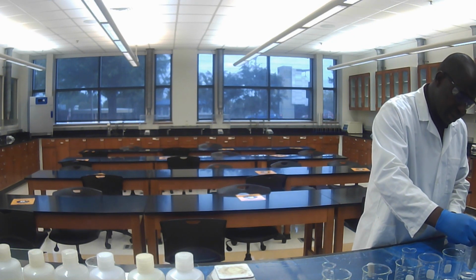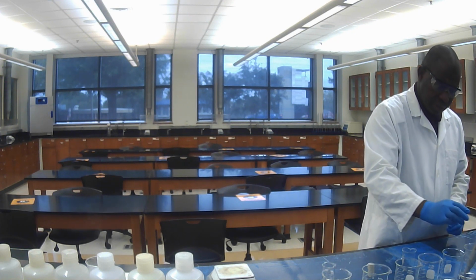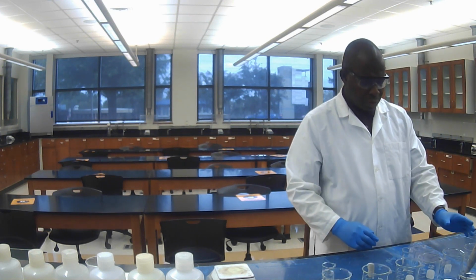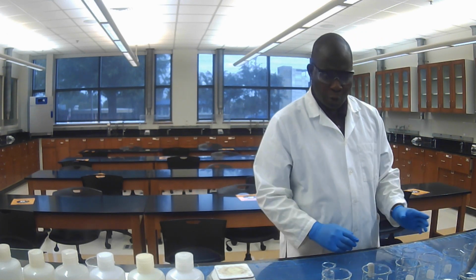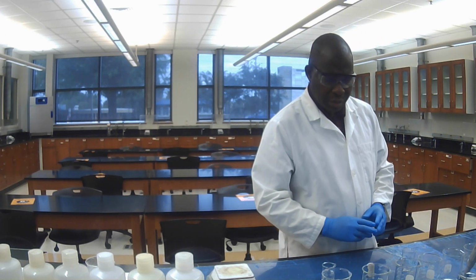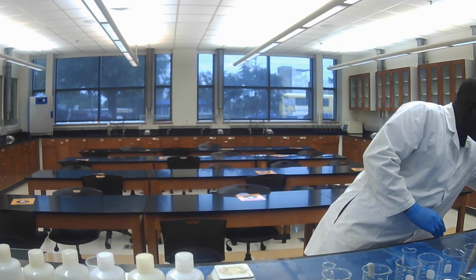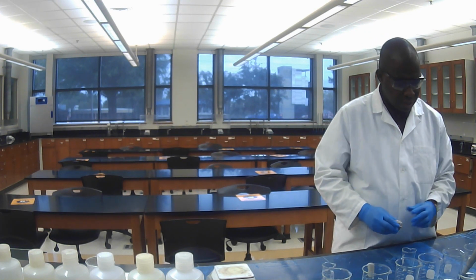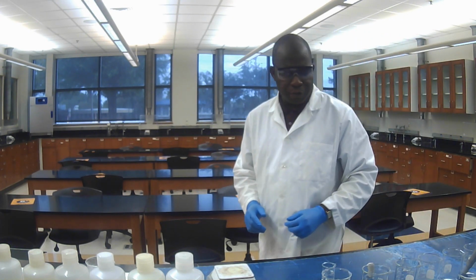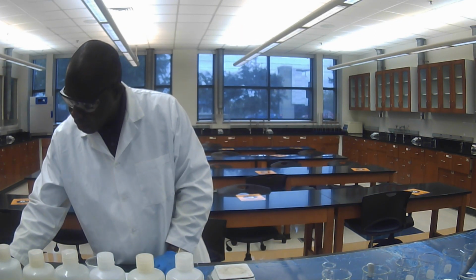I'm going to take the first one. The salt in this beaker is sodium acetate. I get the pH of sodium acetate. I'm going to write it down in my lab book.